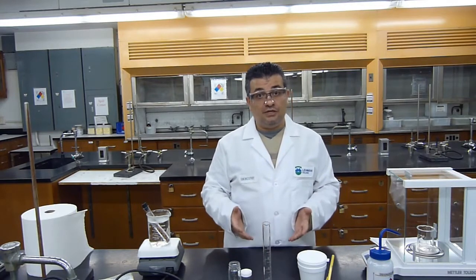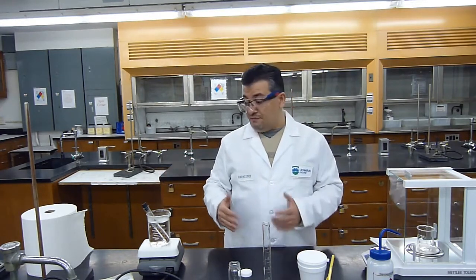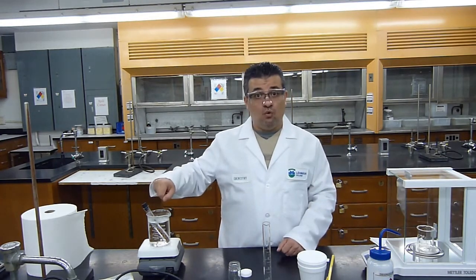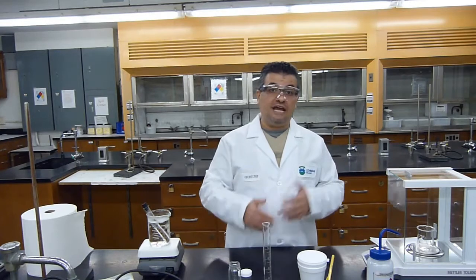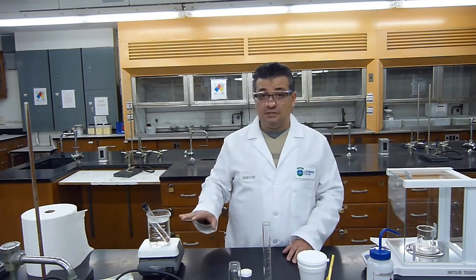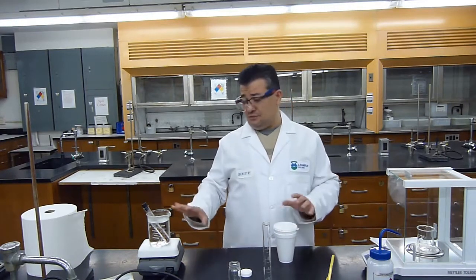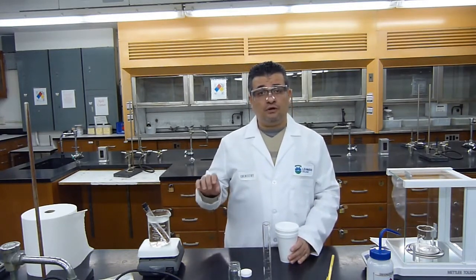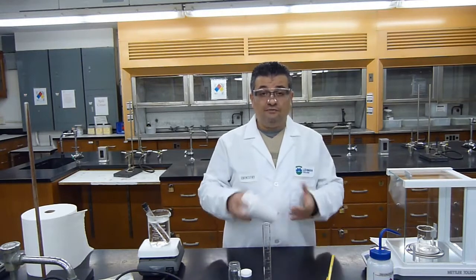Okay, so now I'm going to test, and I see that my metal is below the level of water, which is good. If I see that the metal is above, there are 2 things I can do. If there's still room in my beaker, I can add water. If there isn't enough space, I need to take some metal out and re-weigh the metal that I begin with. But this here is good, so I'm going to keep the mass of the metal that I have. I will subtract the 2 masses. This is called mass by difference, and I will obtain the mass of the metal. I'm going to let this reach boiling, and once the water begins to boil, I'll begin my timer and let it incubate in boiling water for 10 minutes.